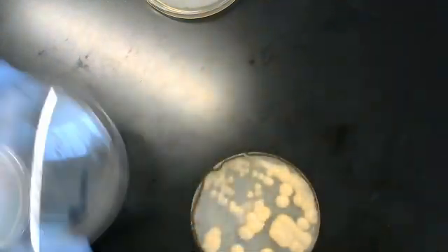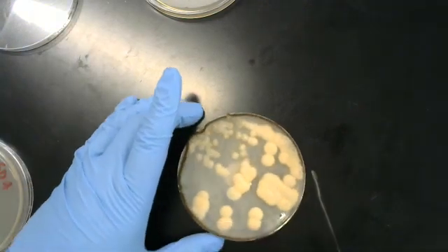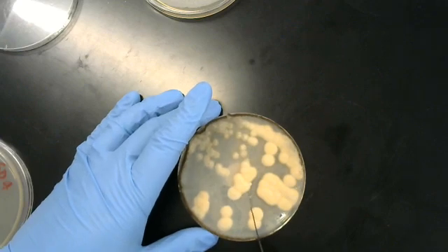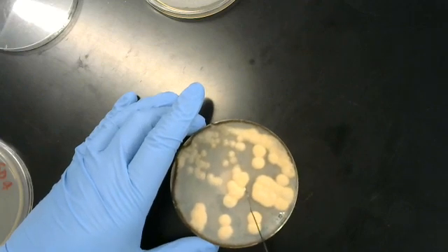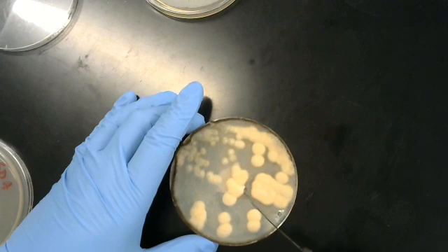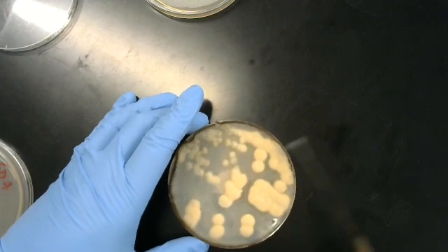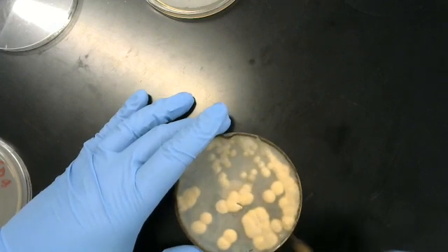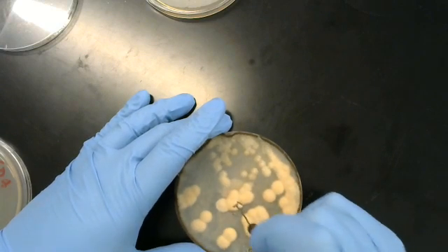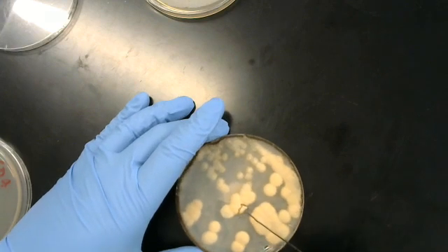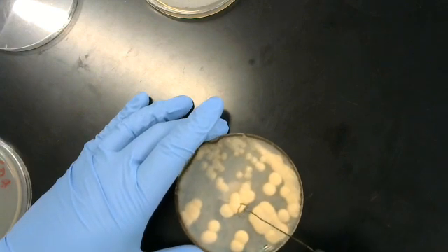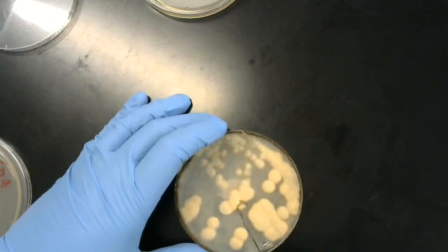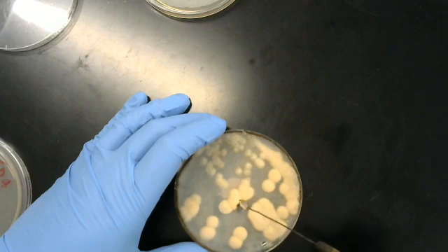So let's remove the lid here. You can see that there's a lot of growth. And we are just going to reach down with our loop here, go into the agar, come out of the agar with a bit, a small amount of the agar and the growth. Right like that.